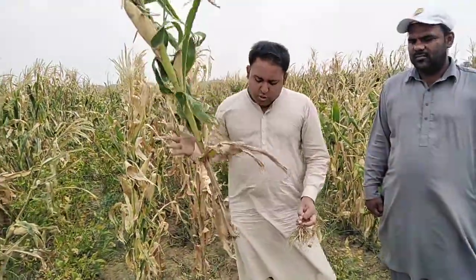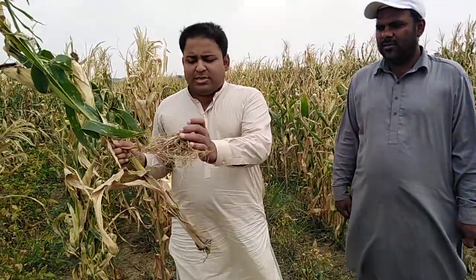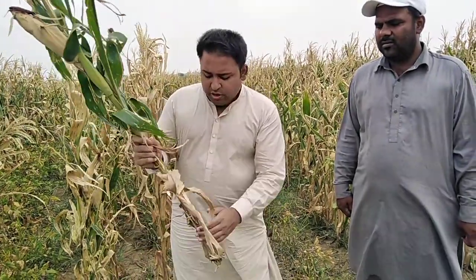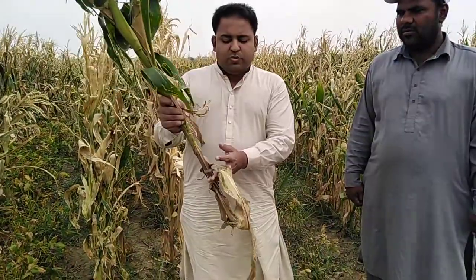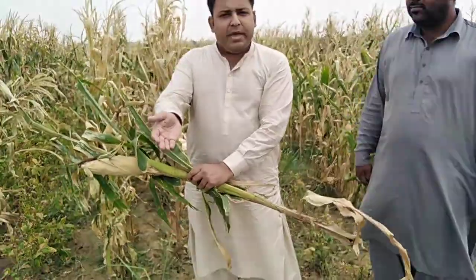So you will come to the field. First, from every treatment you will take 5 plants. Not cut 5 plants, you will dig the plant and remove the roots and then the whole plant. Then you will cut the roots from here. This is the root, separated. Then you place this root into a separate paper bag. Then you will remove all leaves from here, but you will use scissors to cut the leaves. All leaves you will cut from here and then put all leaves in a separate paper bag. Now you have 2 bags, one for root, one for all leaves.